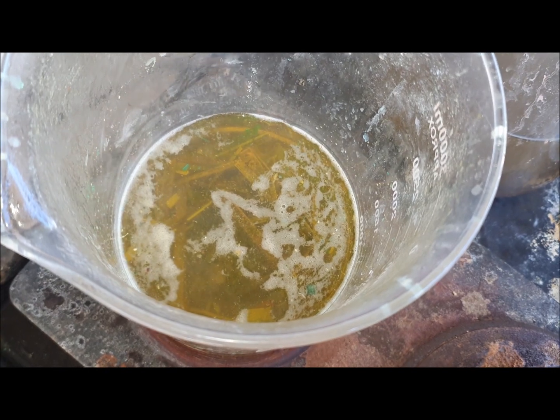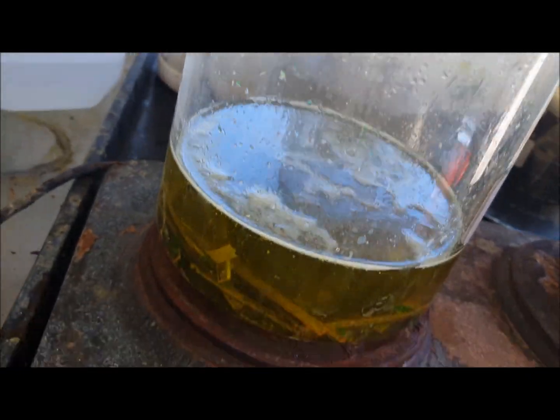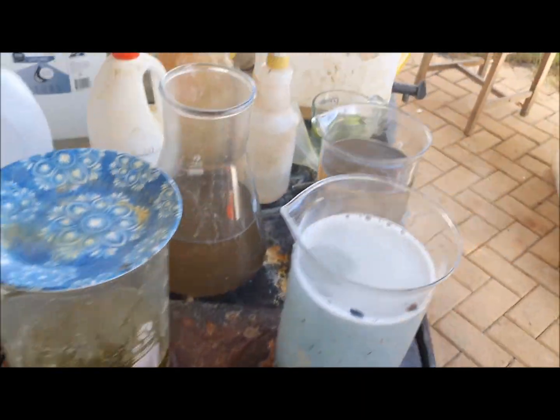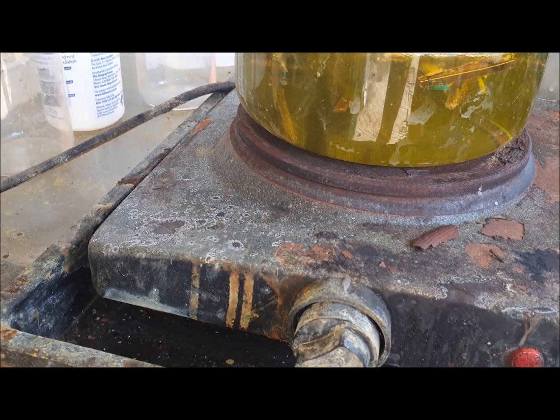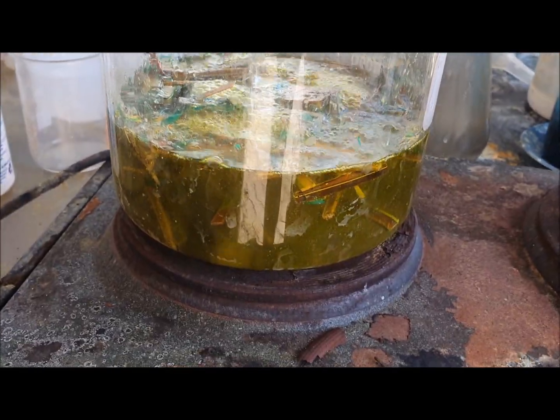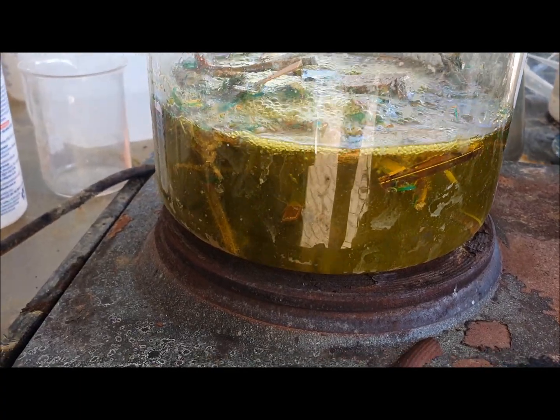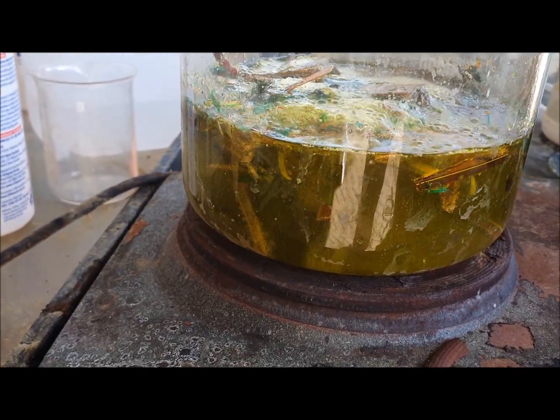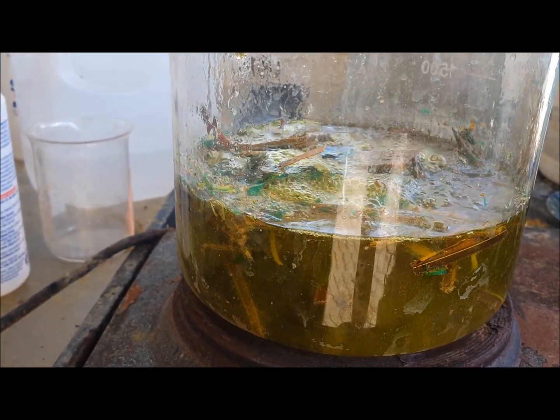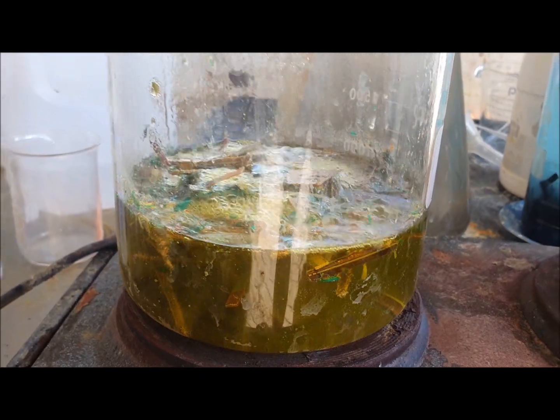I'll put a cover on it and let it sit. After about half an hour if I still see any gold flakes I'll know I need to put a little bit more nitric in. I can just see some faint things floating around — most of the gold has dissolved but I'm going to put one more squirt of nitric in. I'll put the heat up a little bit and should be able to see some fumes start appearing soon. When the fumes stop you'll know there's no more reaction or the gold's dissolved. All the gold is dissolved — it's time to take it off the heat, let it cool down, and then filter it. It's a nice yellow color with no contamination from copper, which was the whole idea of putting it in nitric first. Hopefully with a really nice yellow colored aqua regia there should be a really good gold drop with a nice chocolate brown color, as opposed to the black soot I've been getting.